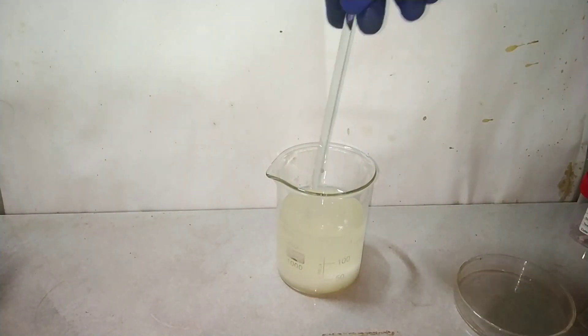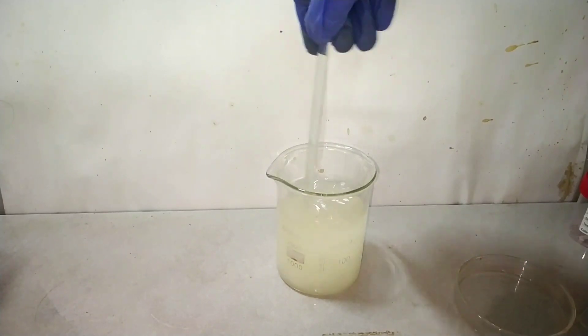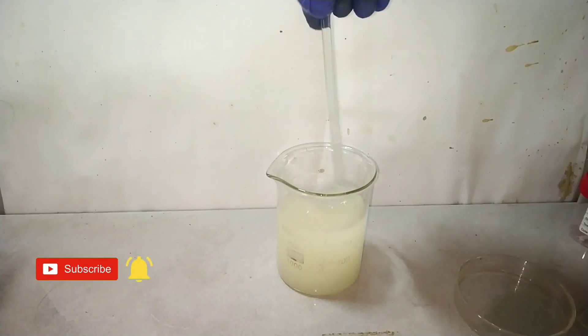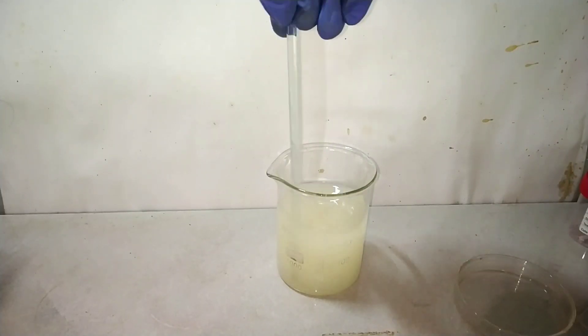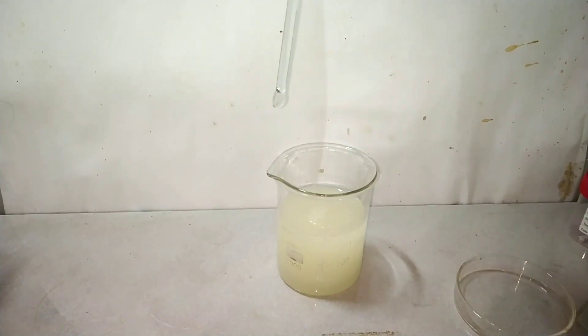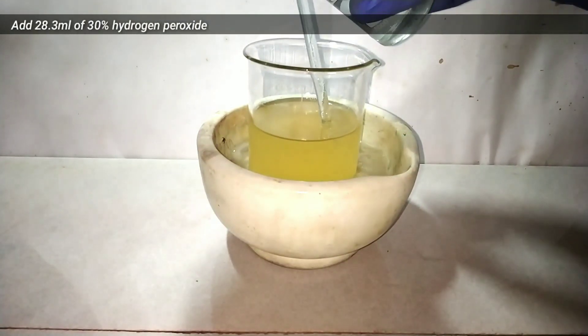I had to use a separate 100 ml and 50 ml graduated cylinder since I did not have a very large graduated cylinder. After adding the water, stir the contents with the help of a glass stirring rod to dissolve it. Then keep it in an ice bath to cool.